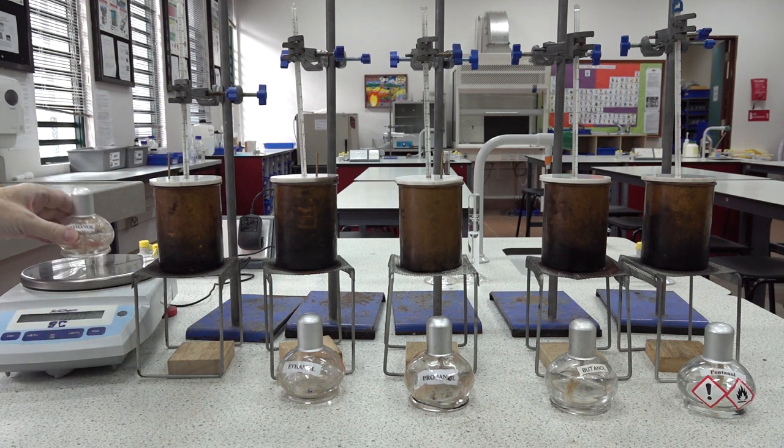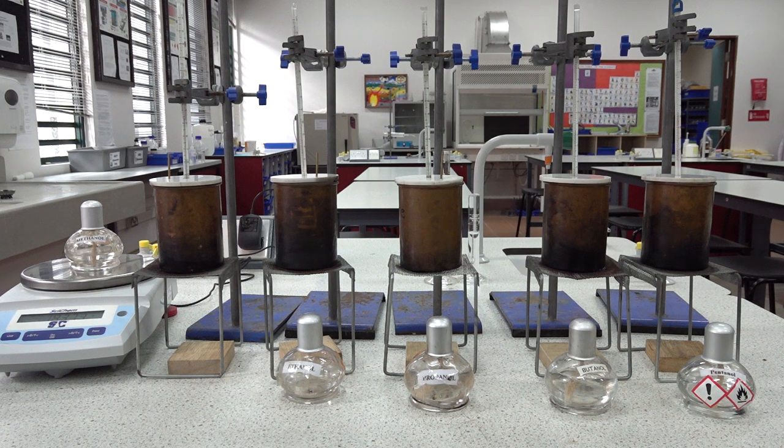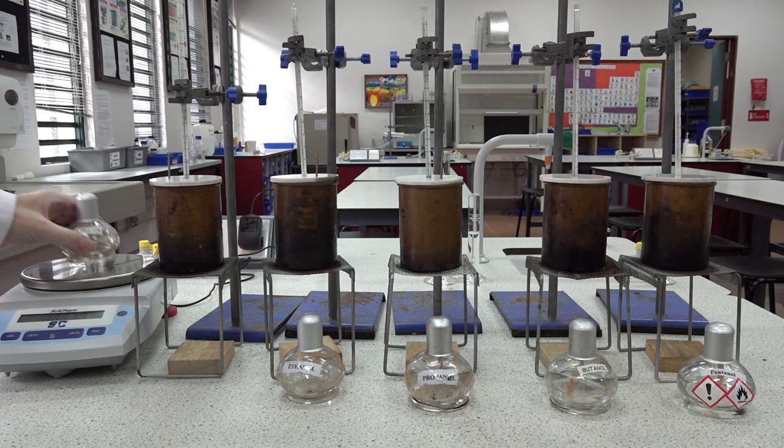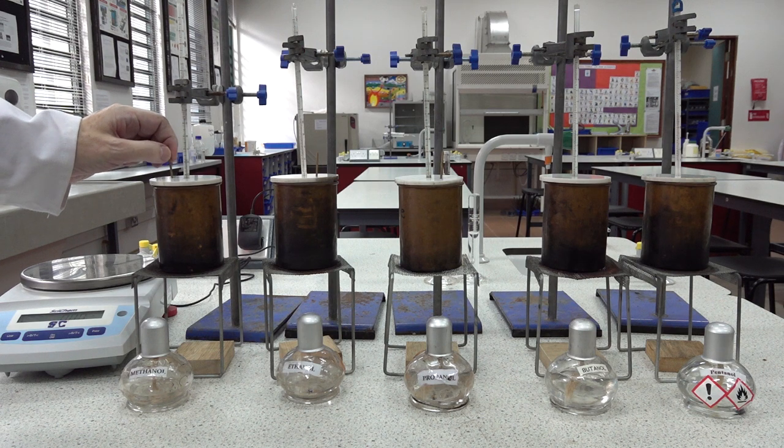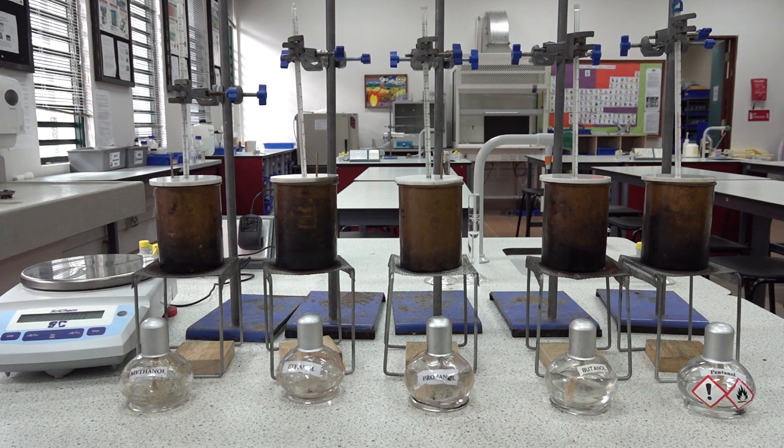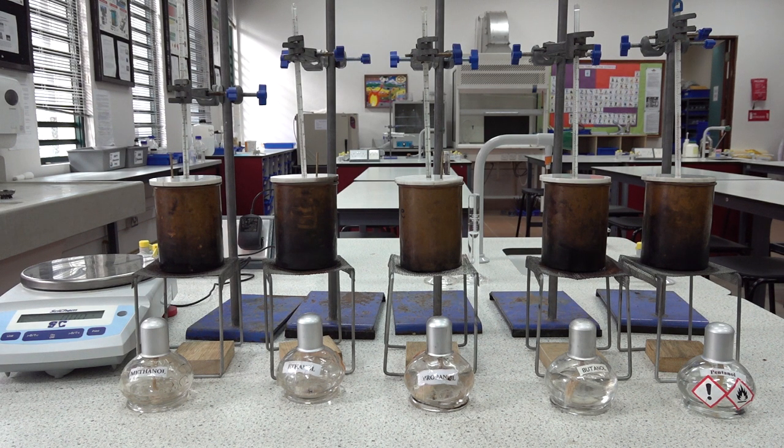Let's take another mass reading for the spirit burner. The reading is now 183.72 grams, and the thermometer is still reading 34. So there we are, the enthalpy of combustion of five alcohols. Thank you.